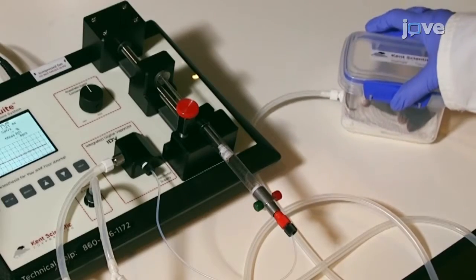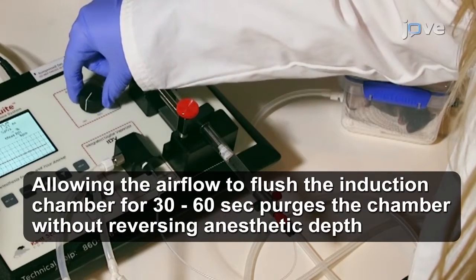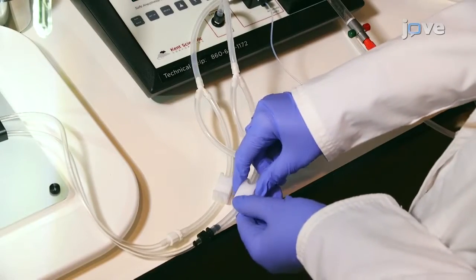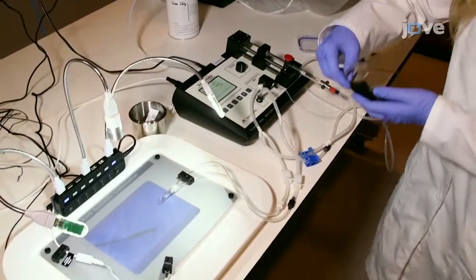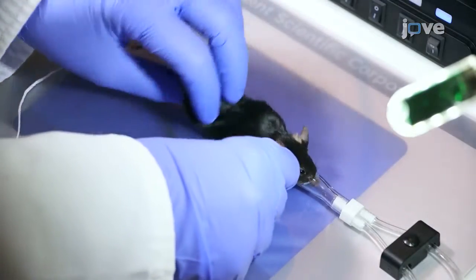Once the animal is sufficiently anesthetized, turn the anesthetic agent concentration dial to deliver 0%. Then, open the clamps to direct the airflow to the nose cone and close the clamps leading to the induction chamber. Remove the mouse from the chamber and immediately place on the nose cone.